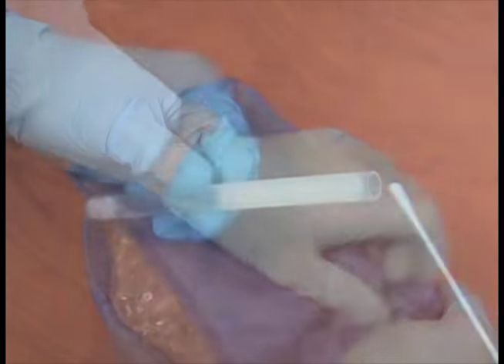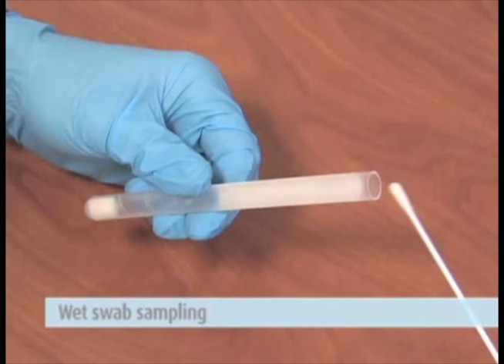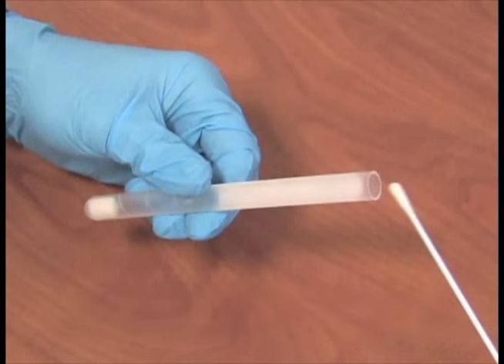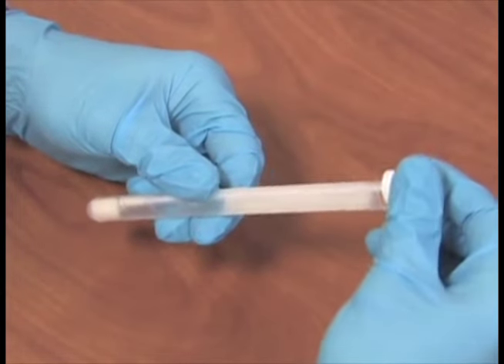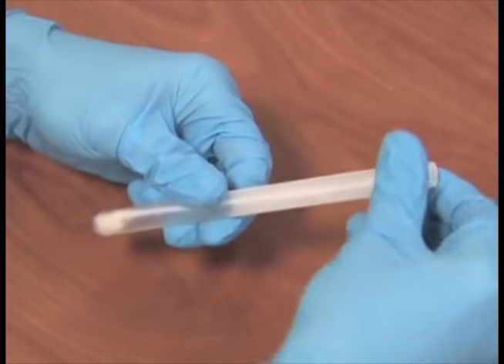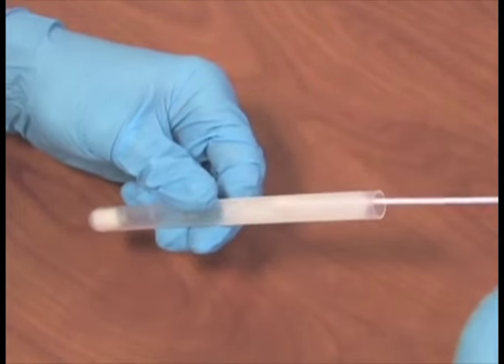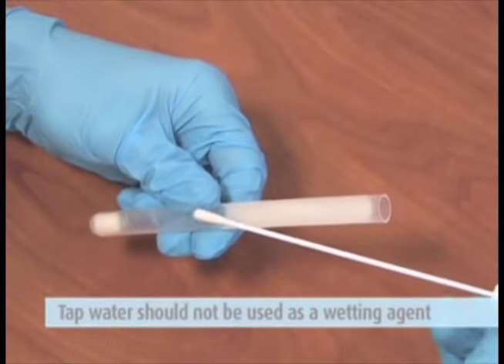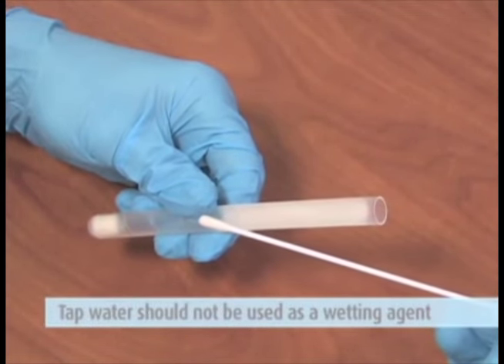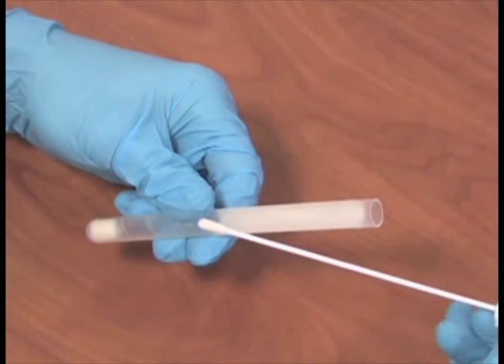Notes for swab sampling. Some investigators prefer to sample with a wet swab rather than a dry swab, as noted above. The media-soaked sponge in the swab case can be used for wetting the swab as the media is sterile. Tap water should not be used as a wetting agent because it may contain microorganisms that could interfere with analysis.